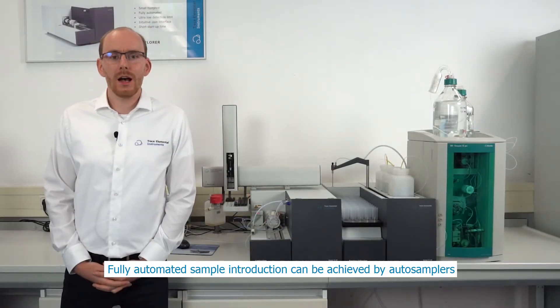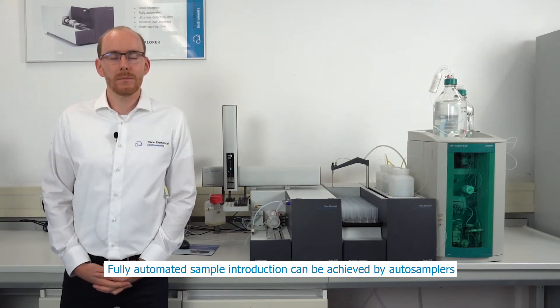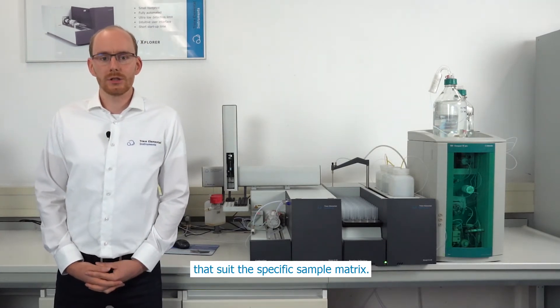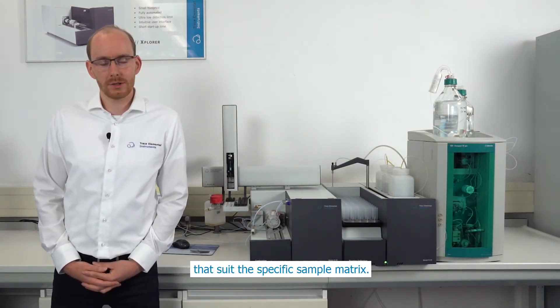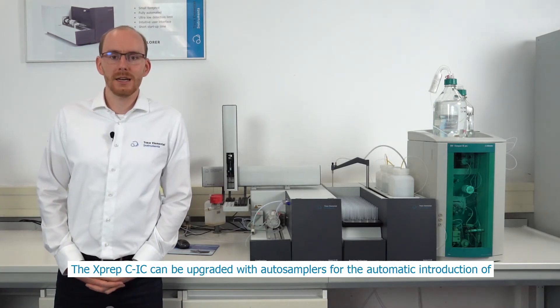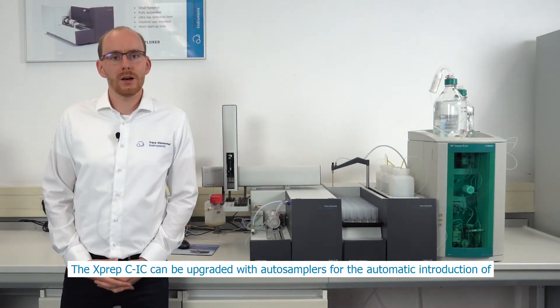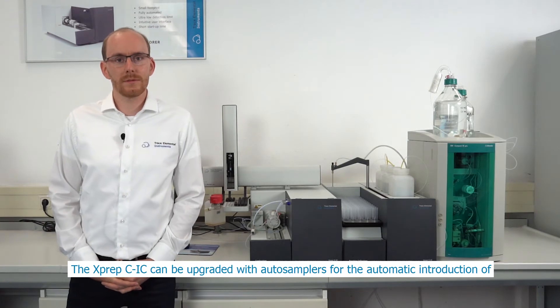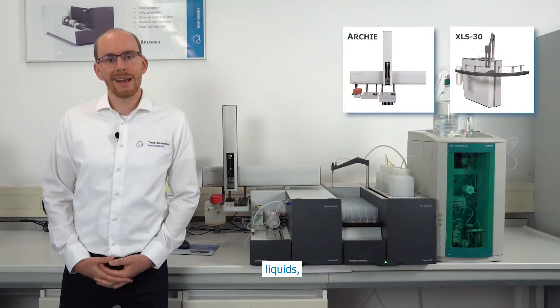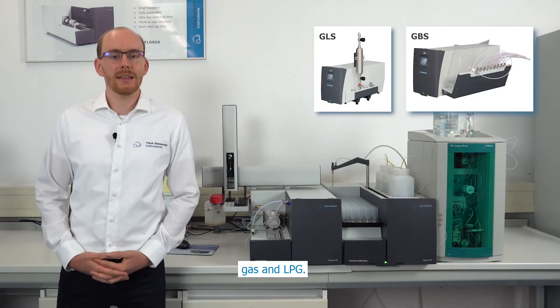Fully automated sample introduction can be achieved by auto samplers that suit the specific sample matrix. The X-PREP CIC can be upgraded with auto samplers for automatic introduction of solids, liquids, gases and LPGs.